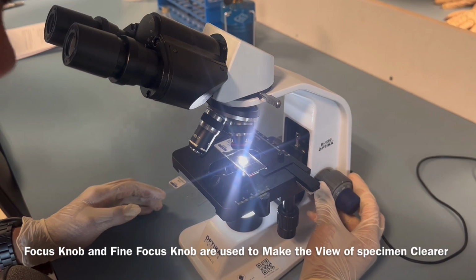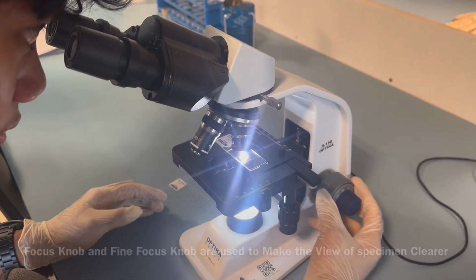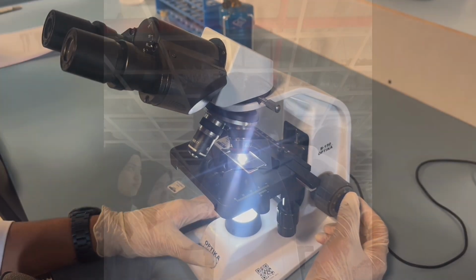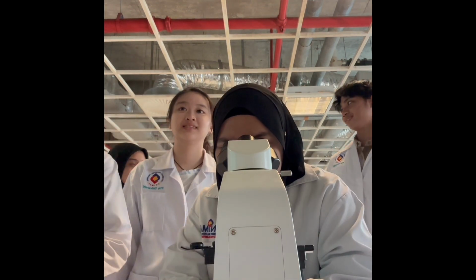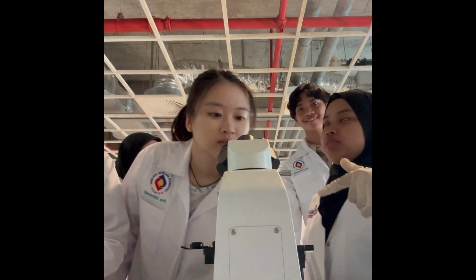And then the focus knob and fine focus knob are used to make the view of the specimen clearer so that it can be viewed in HD, clearer image. So with that all done, the specimen slide can now be viewed through the ocular lens.